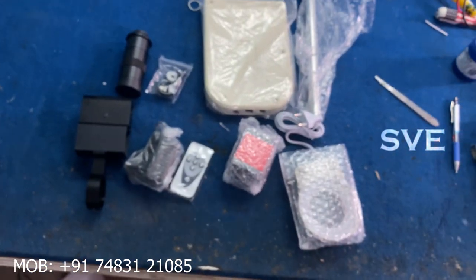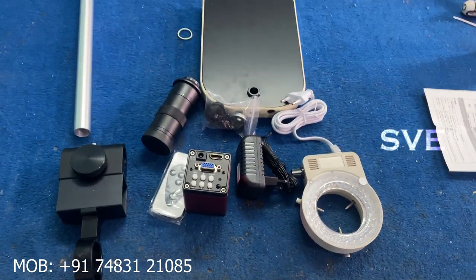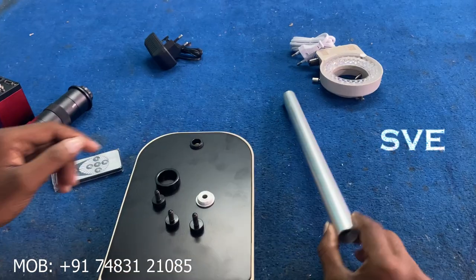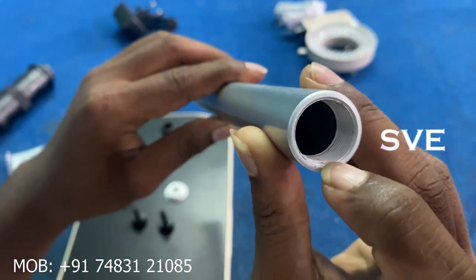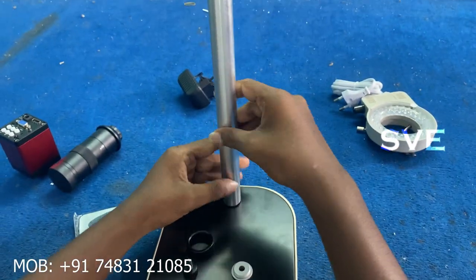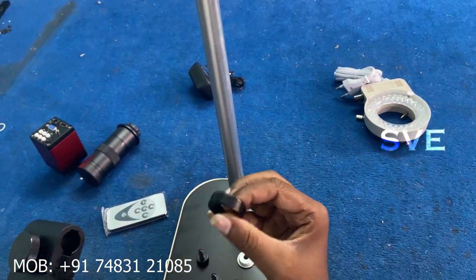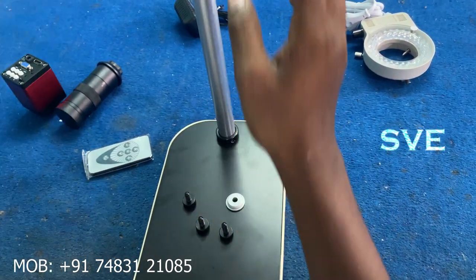As I look at the product, these are the assembling parts. Let's assemble it. First I am starting with the base. To that base, we have to fix this aluminium pipe here. You can see both sides — a little thread here. We have to fix it like this, and there is a ring to place outside the pipe.